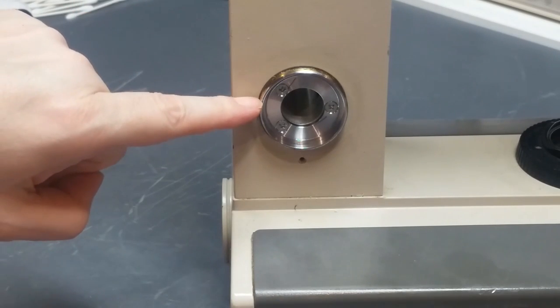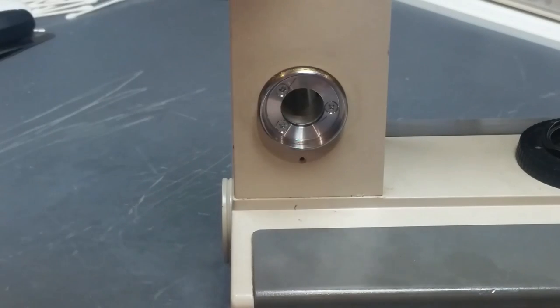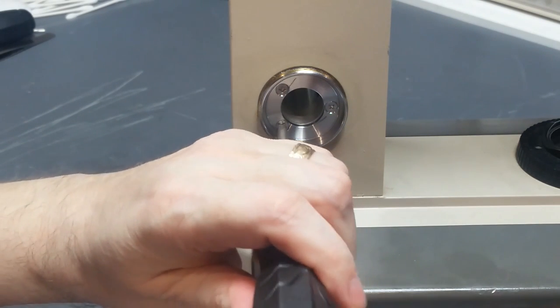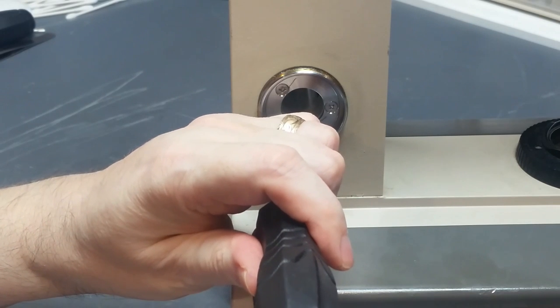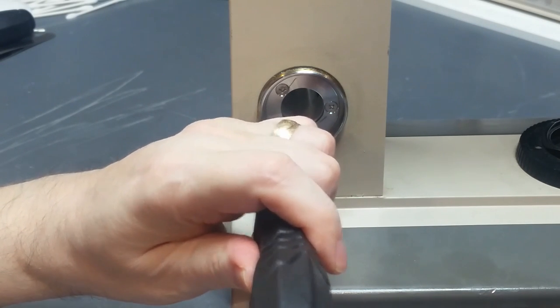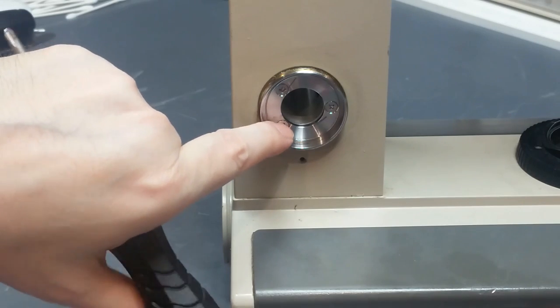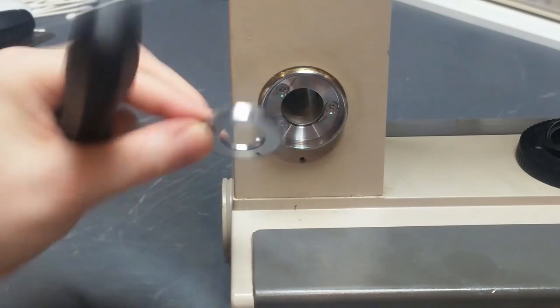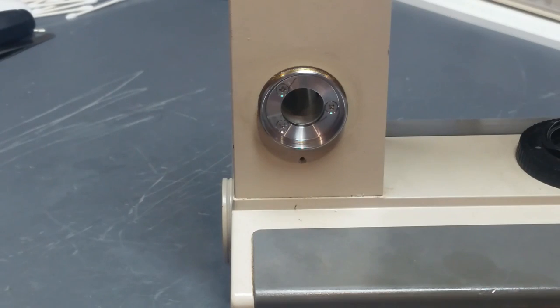It's not necessary to remove this piece. You can certainly clean it with it in place, but on the other hand, it's easier to do the cleaning if you can remove it. So I'm going to try to remove it here. If you don't have the confidence or you think that your screwdriver is really not up to the task, then don't try, because you'll just booger up the heads. And if you get a burr that sticks up too high, it'll rub on this and then you ruin the whole mechanism.